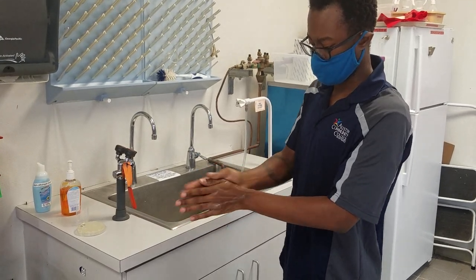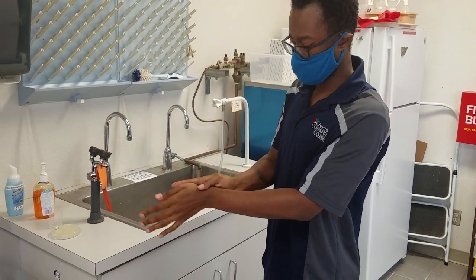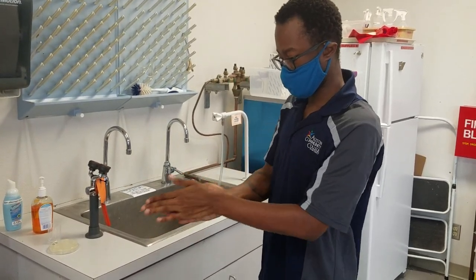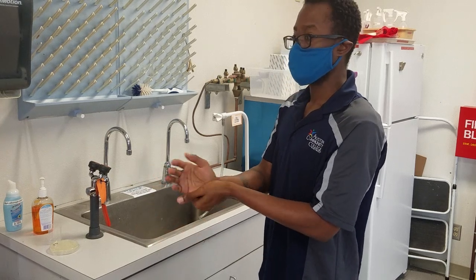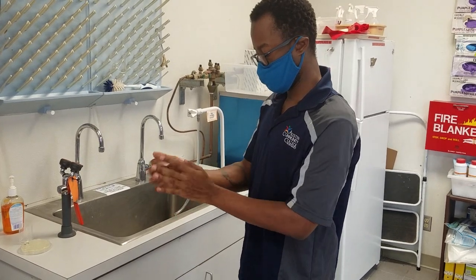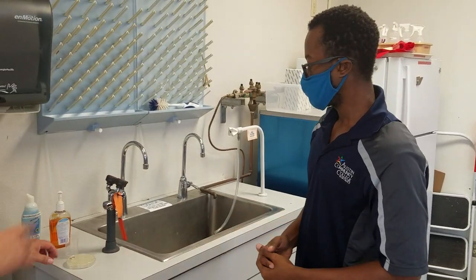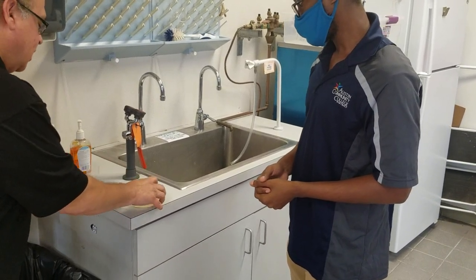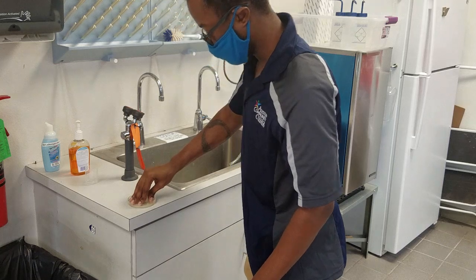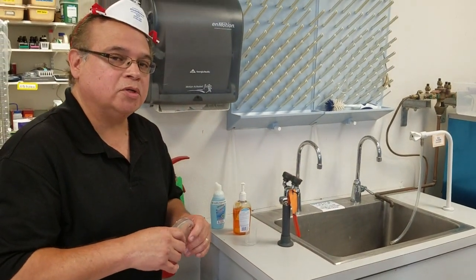When we talk about washing hands, some people call it a de-germing method, but I would prefer the term mechanical method of removal — it doesn't really kill microorganisms, but it removes them. Benzalkonium chloride is a surfactant, a detergent. Alcohol is really good for enveloped viruses like COVID-19, but as you'll find out, alcohol is not a great disinfectant or antiseptic for most other microorganisms — just for enveloped viruses. We'll talk about that in lecture. Now that his hands are completely dry, he'll make the last impression with all fingers and thumb. This plate will be incubated with the rest of the plates for about 24 hours, and we'll show you the results at a later date.